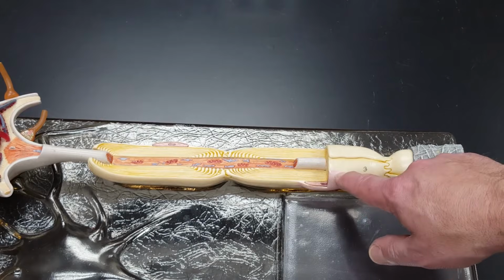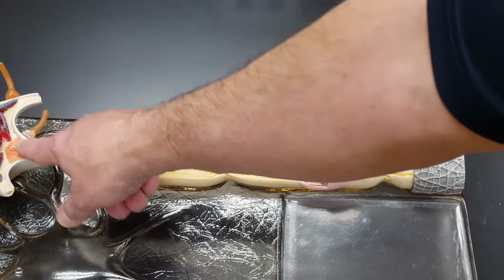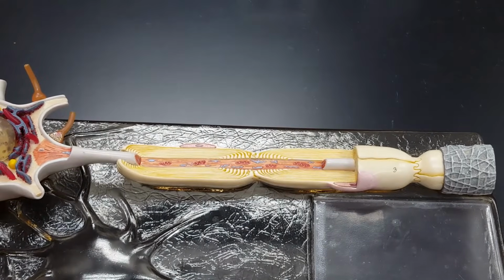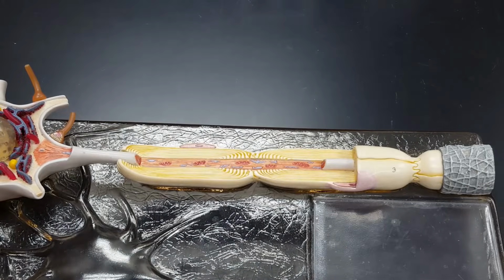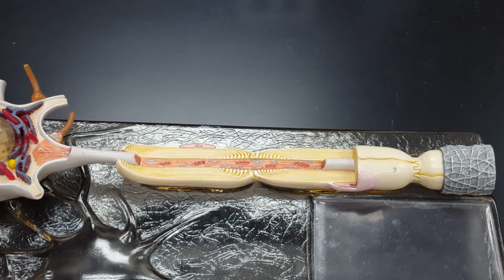Neurolemma, axon, axon hillock, way up there. This particular cell does not have much in the way of good neurofibrils or Nissl bodies, but it does show me this covering very well, right here. Now, I want to be very, very clear with you because you are going to be taking a two-dimensional quiz and practical over this thing. Let's be careful with our terminology.